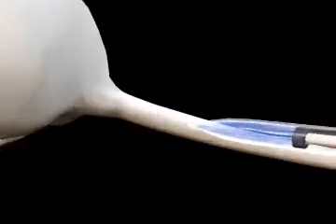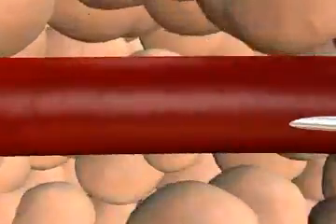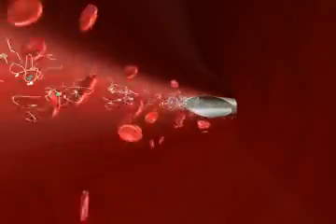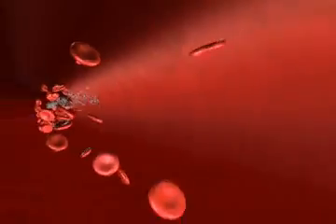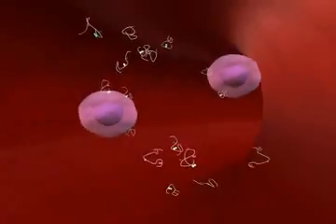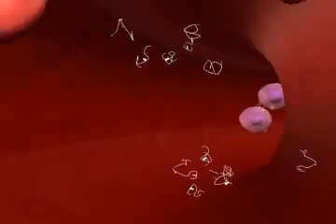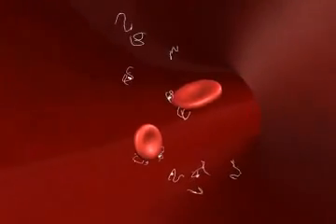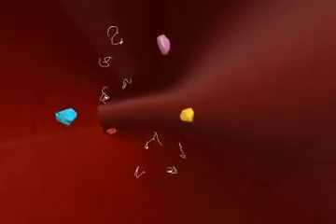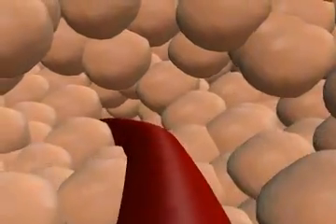A healthy animal, such as a rat, is first challenged with a library size of 10 trillion different molecules. The library is administered through an injection, nasal, or oral delivery depending on the chemical nature and stability of the molecules. It is within the healthy animal that the molecules are exposed to an environment addressing absorption, distribution, metabolism, excretion, and toxicity.